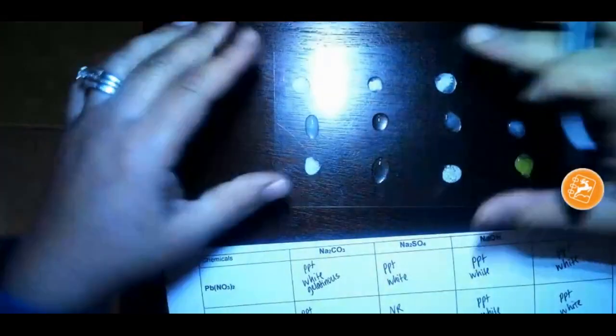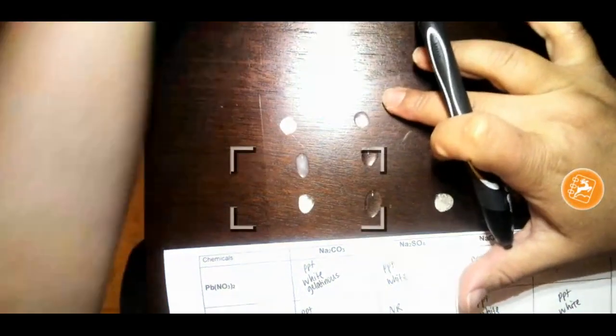So now what I want you to do is give me another descriptive term for this one. You don't need them for these. So let's see this one here. I'm going to zoom in for you so you can see this one.